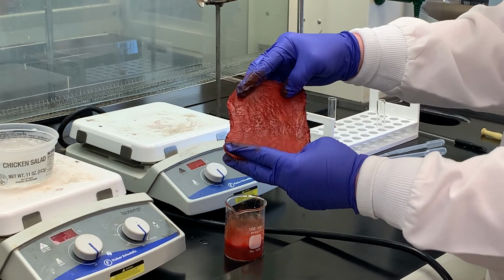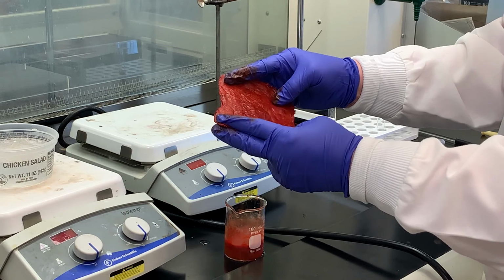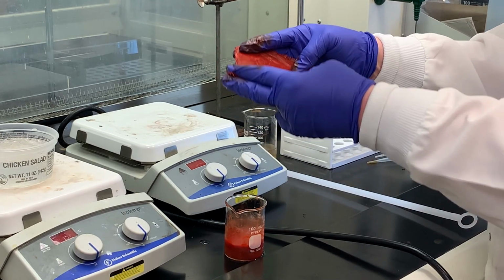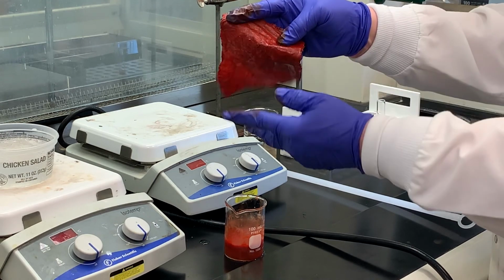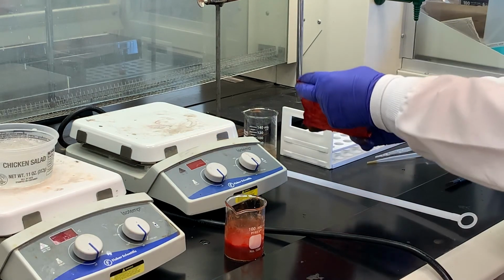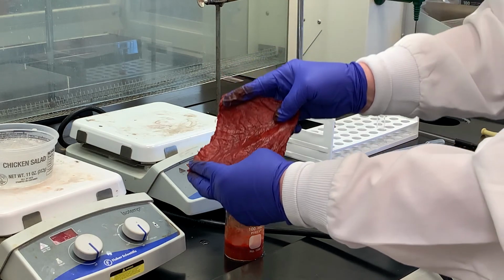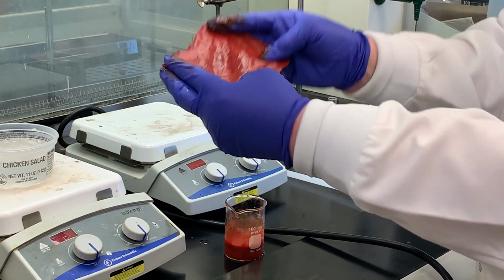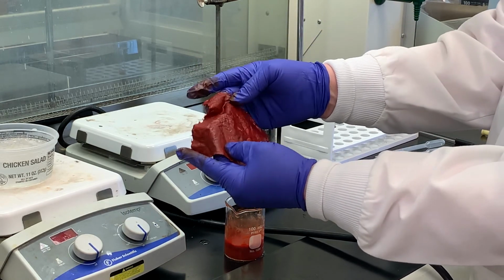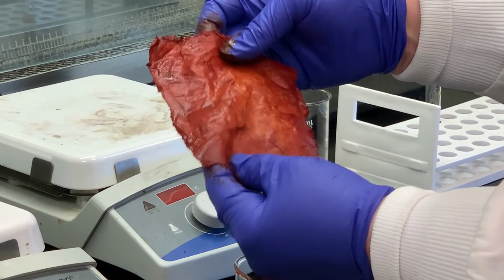so certainly it may not look like level dyeing, but in the real world, what some companies do, let's say they had this piece of fabric, and of course they would be looking at thousands and thousands of yards of this. They would put this on some type of roller, immerse it into the coupling component, then it would come up, probably air dry a little bit, and then it would go into the solution of the diazonium salt, and then you've got the dye stuff on the fabric. I'm doing this on a small scale, but you can see it's a pretty decent color saturation on the cotton.